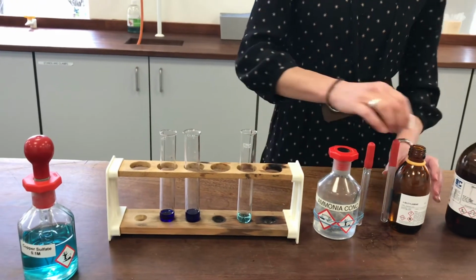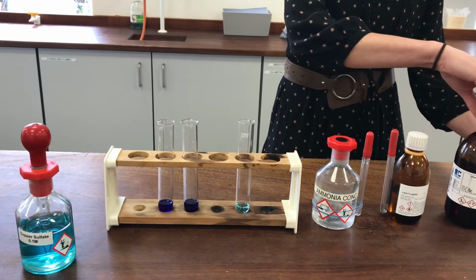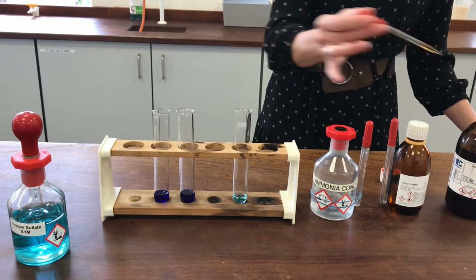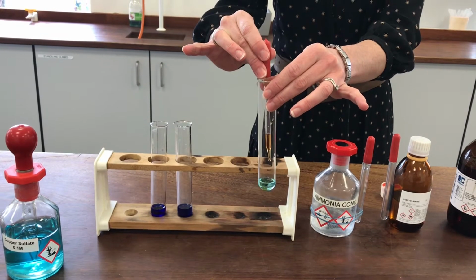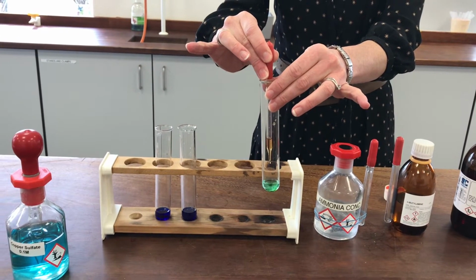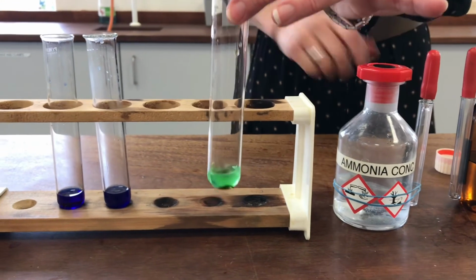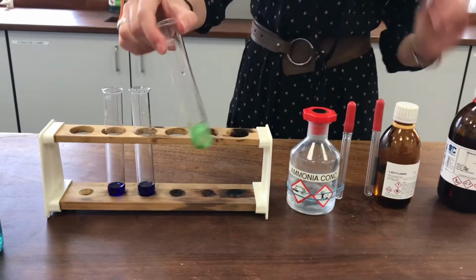It's a subtly different colour. And finally, I've got the phenylamine that I'm going to try. Now this one might be a little bit tricksy because phenylamine, as we know, is not very water soluble, so I might need to heat this one. We'll see how we go. I think it's making a sort of slight greenish colour to it, but I think that's actually due to the colour of the phenylamine itself, which has a sort of yellowy colour to it, as you saw. Let's try heating it a bit and see what happens.